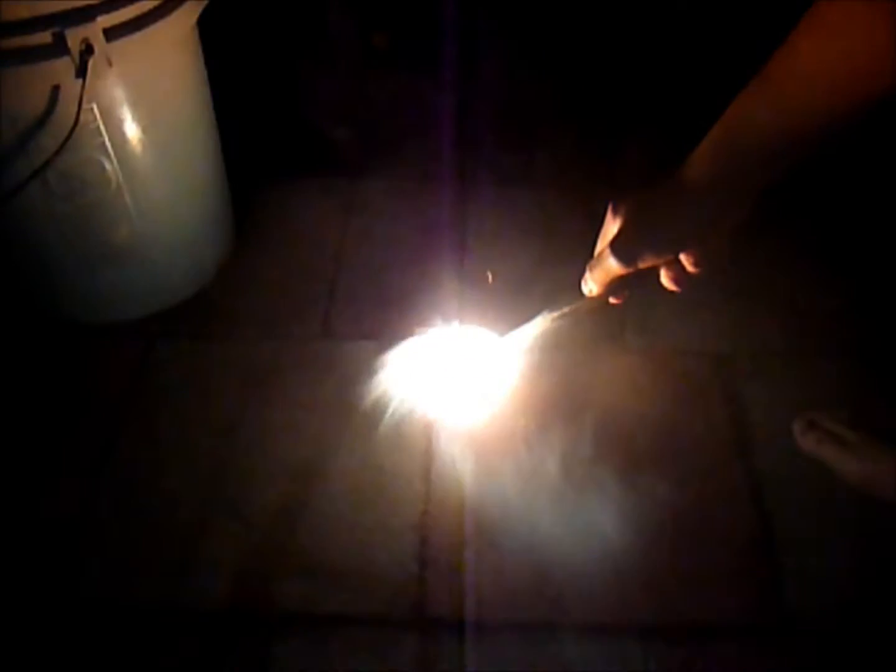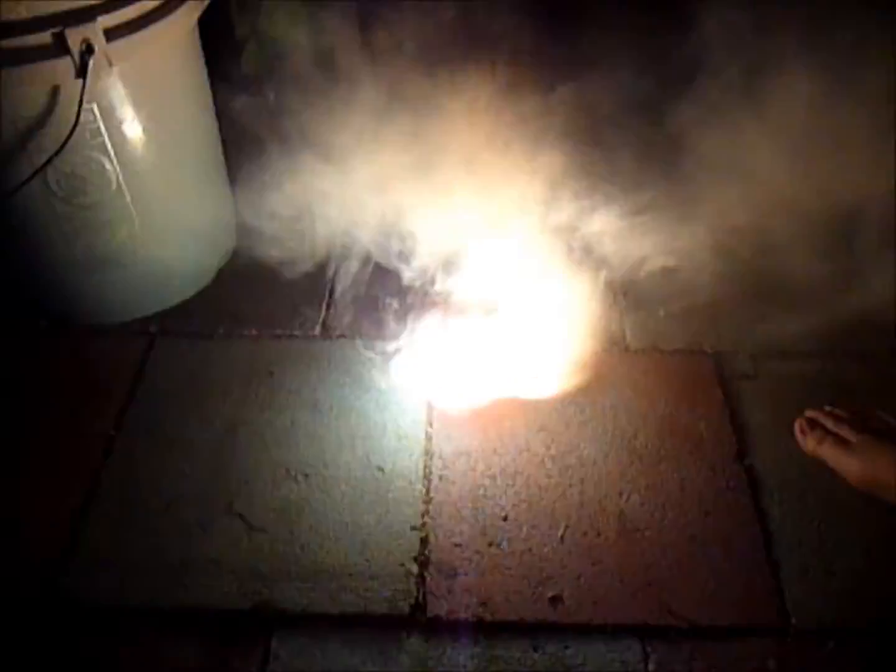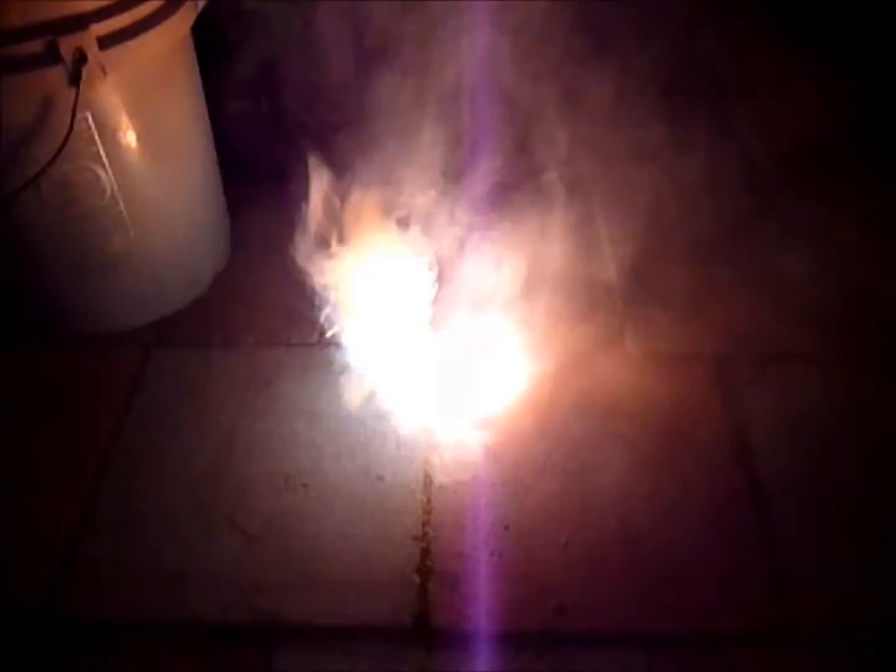Oh, I turned off. Okay, still not done. Needs more on the other side. Okay, that's an awesome reaction.